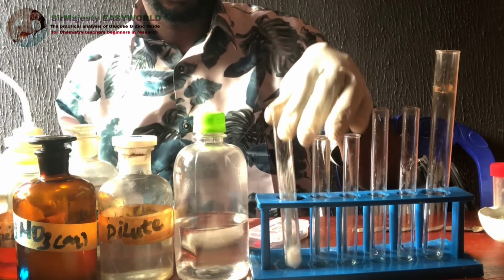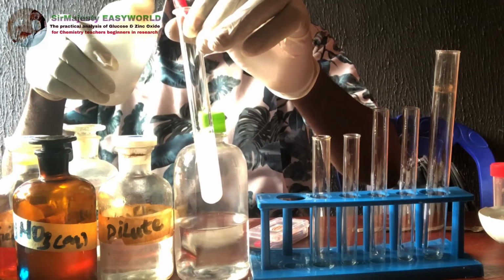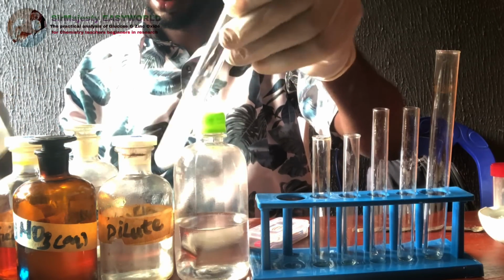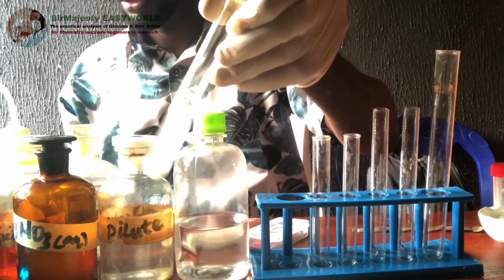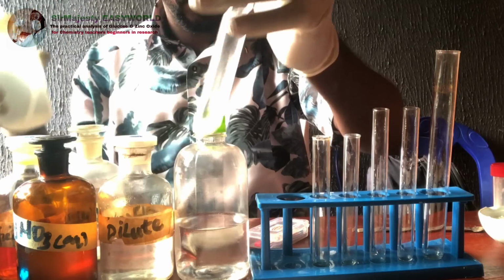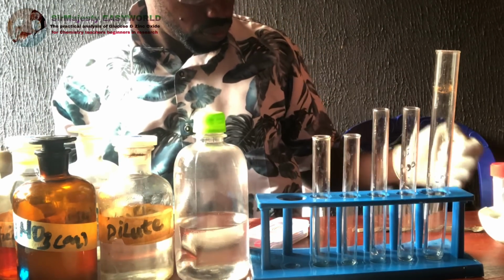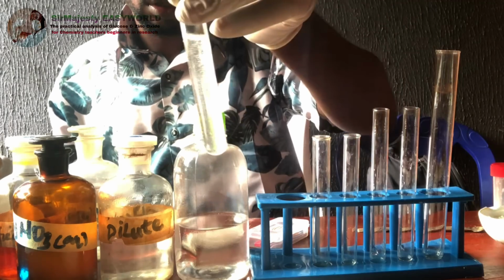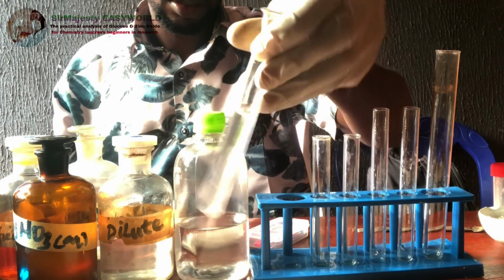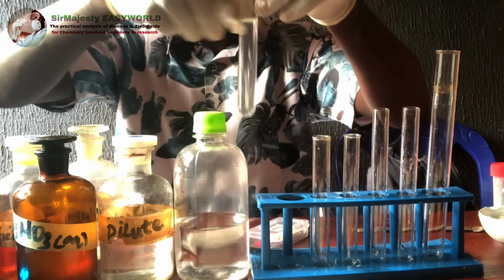There will also be the inorganic compound, the zinc oxide analysis. Normally, you need to use a glass rod to facilitate the dissolution. It's highly soluble. It's dissolving, giving us a clear solution. These are the reagents we need for this analysis.